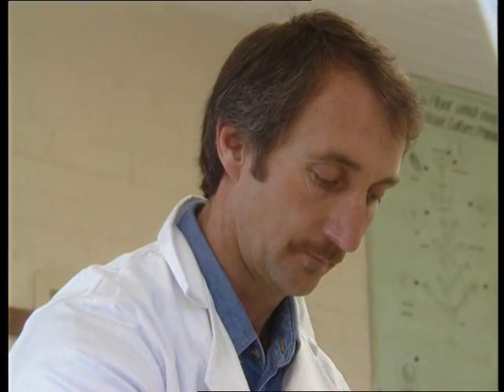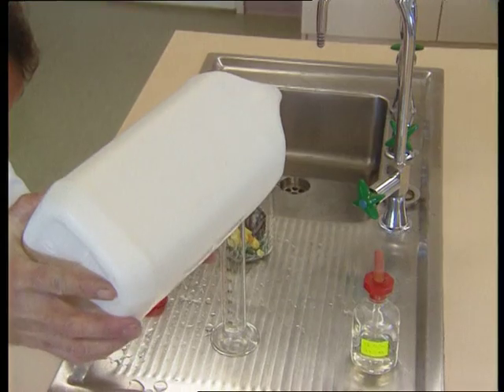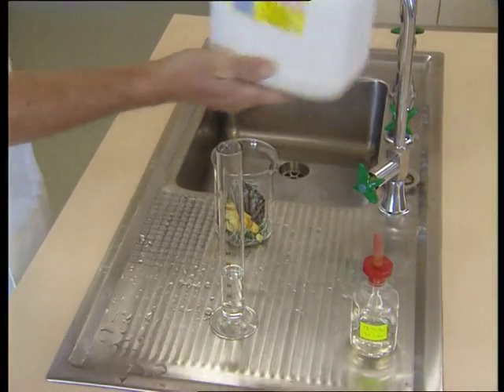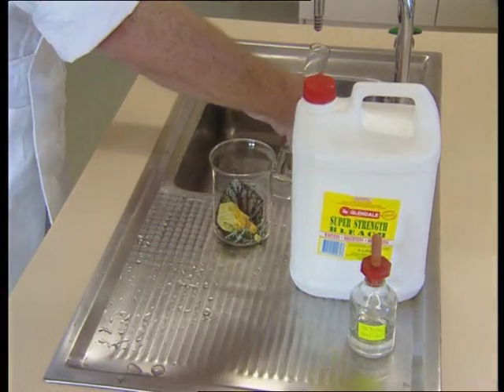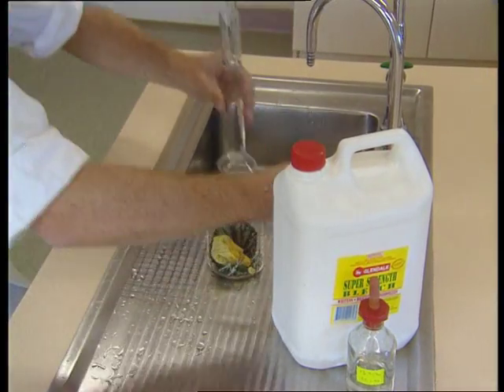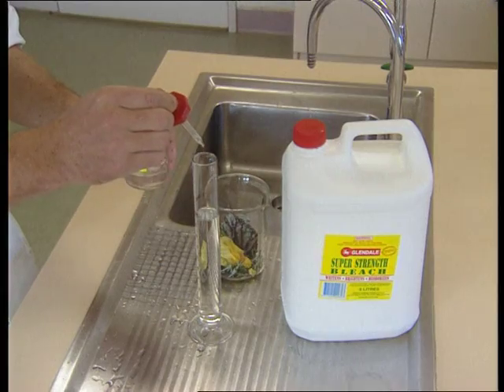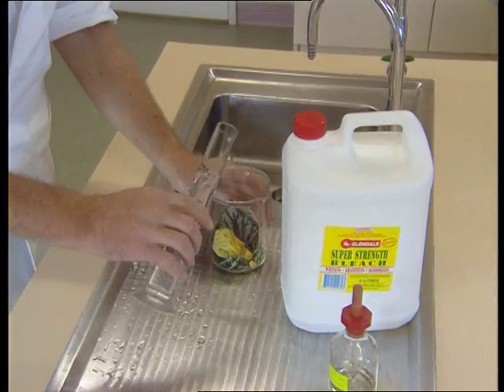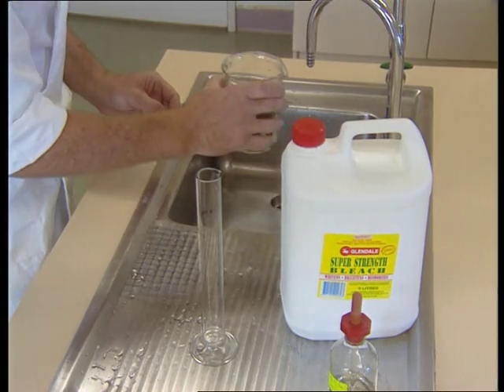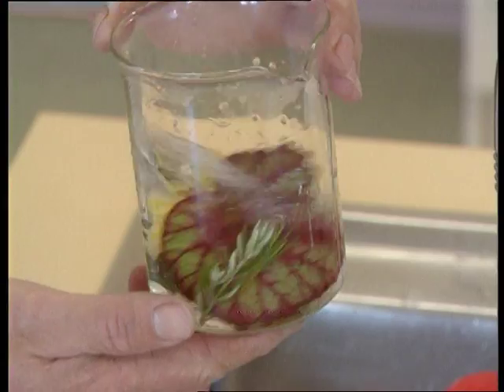The third step is to wash the plant material in a chlorine solution such as sodium or calcium hypochlorite. These are sold as commercial household bleach such as White King. This is a strong chlorine solution and requires dilution to one quarter strength, giving a chlorine concentration of 1% weight per volume. It is best to prepare this solution fresh. To this solution, also add a drop of wetting agent such as Tween 20, Triton, or any non-ionic detergent. The surfactant or wetting agent will improve the surface coverage. The plant material can be washed in this solution for 5 to 20 minutes, sometimes even longer.